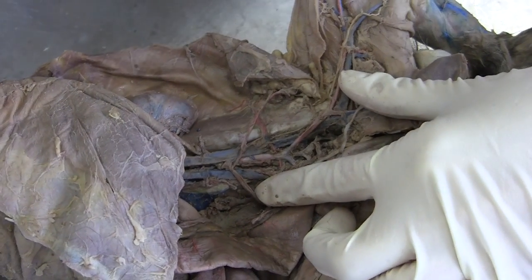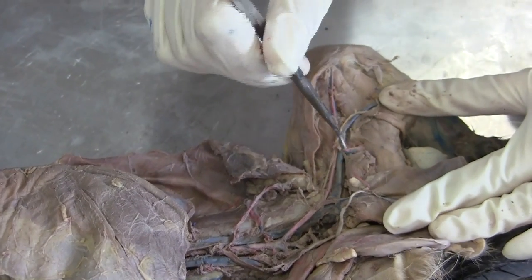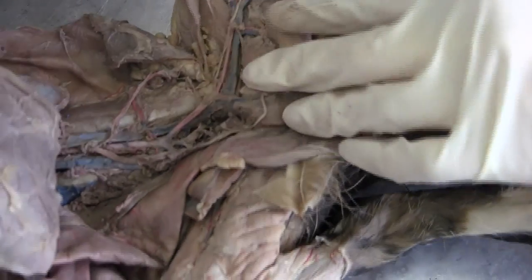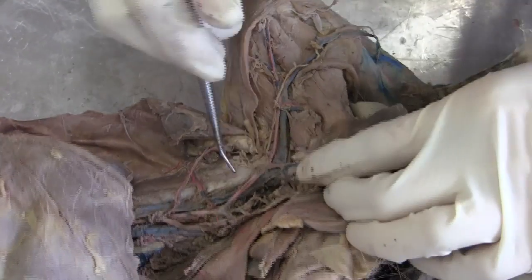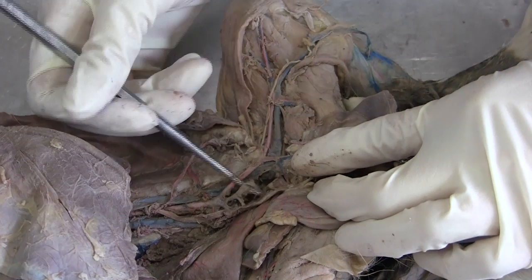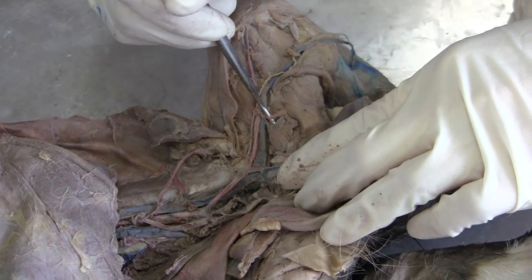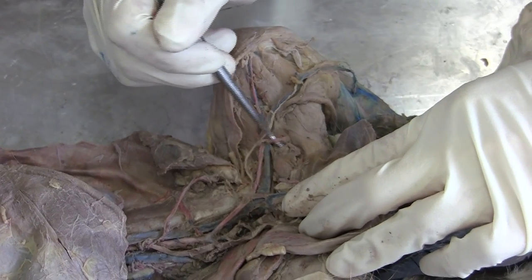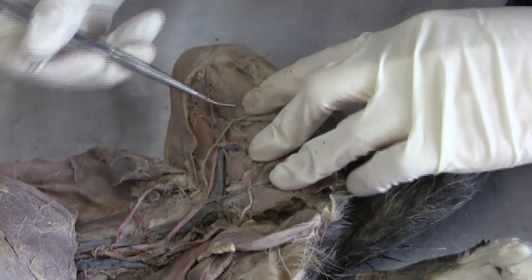Do you know where the saphenous vein is? Yeah, somewhere there — this one. So this one is the proximal femoral artery. And from here: external iliac vein, internal iliac vein, and here is the femoral vein. This is the femoral artery, and the other one is also femoral. That small one is the saphenous vein.